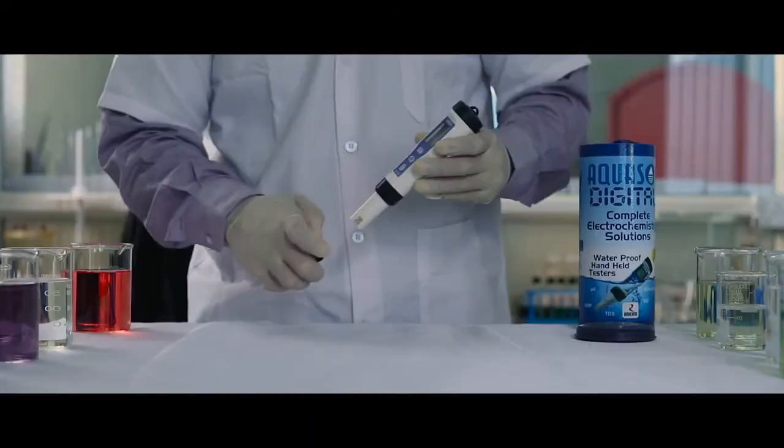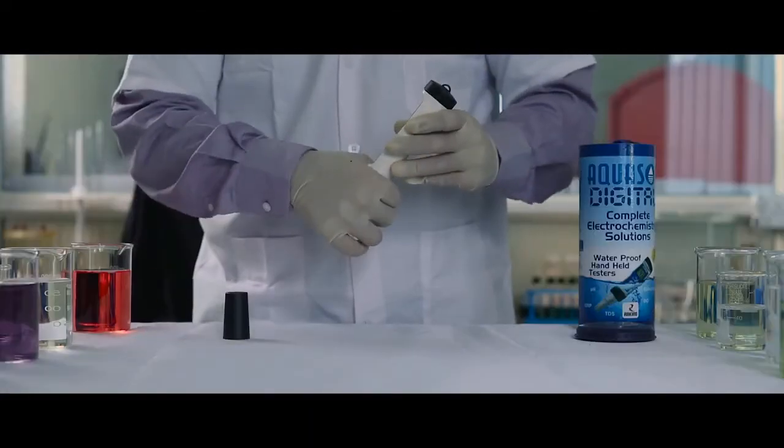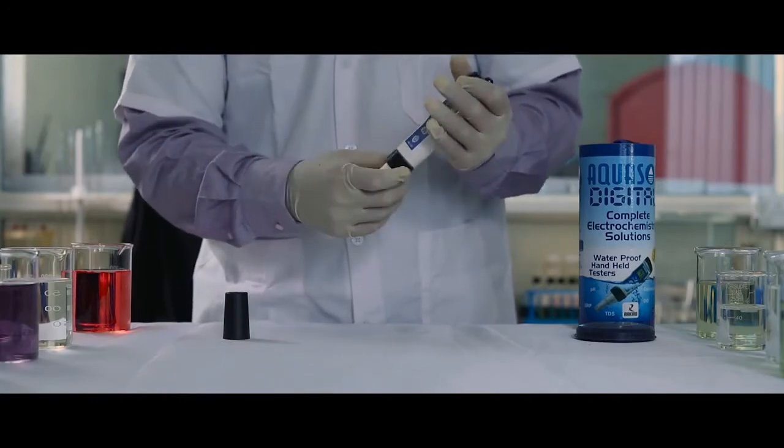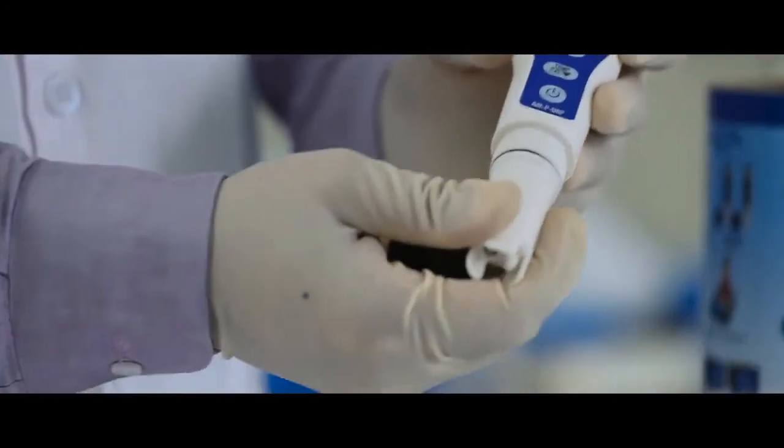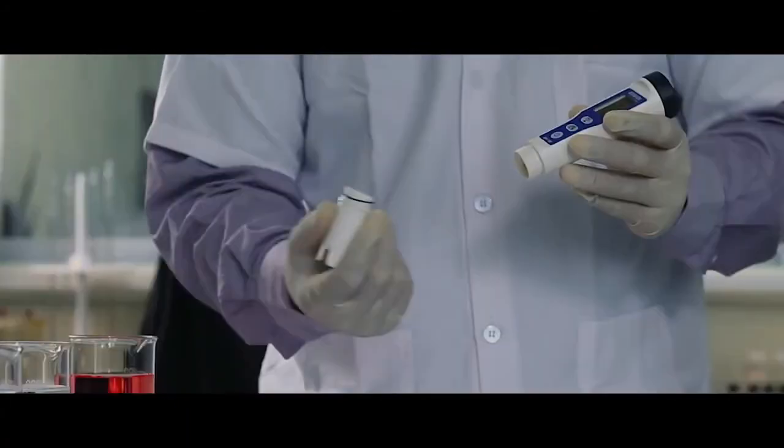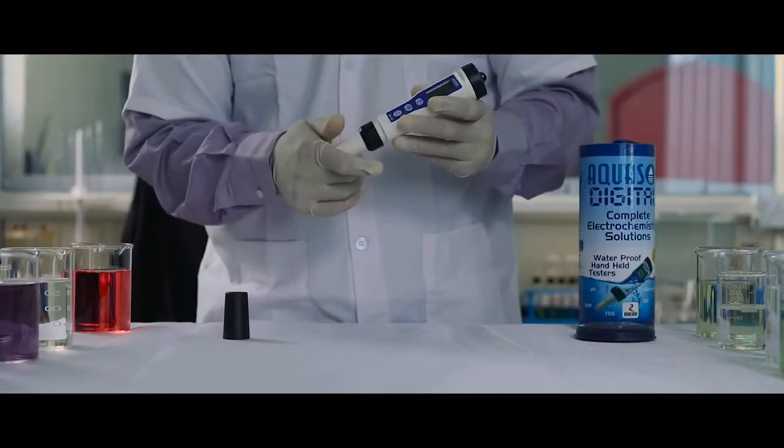To replace the electrode, remove the cap and unscrew the electrode holder. Remove the electrode, replace it with the new one, and screw the electrode holder back.